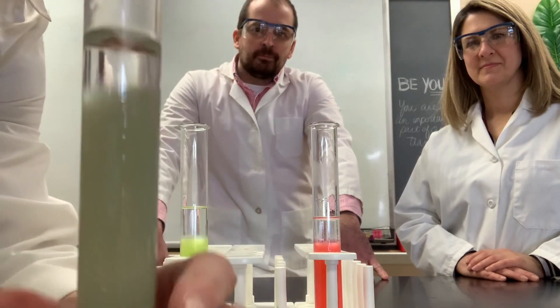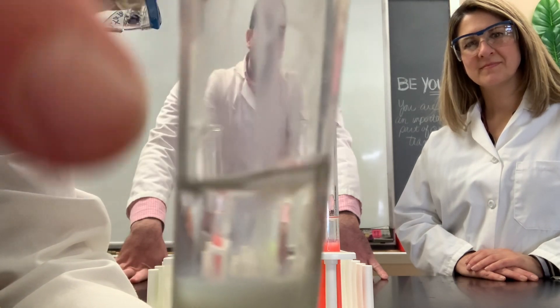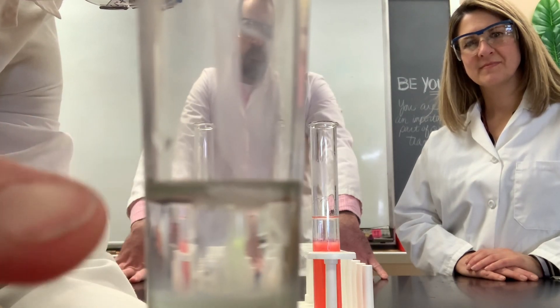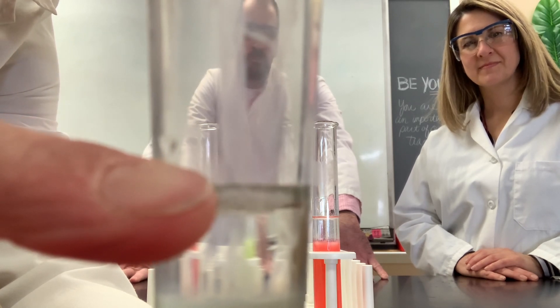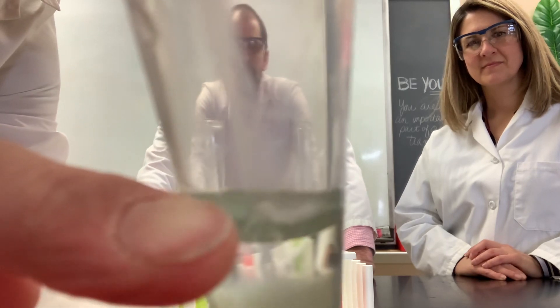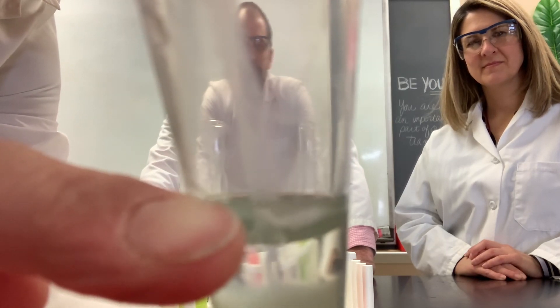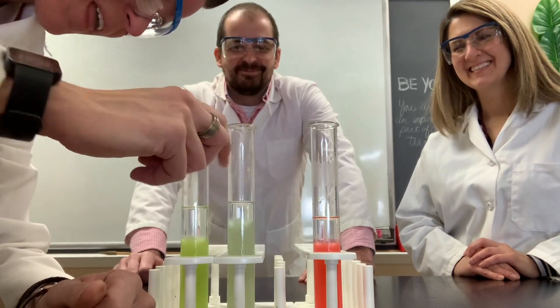Then we're going to go to the banana. That chunk right there — that's the banana DNA. There you can see it. It's a wiggly chunk. It looks like a little bit of snot. That is the banana DNA.